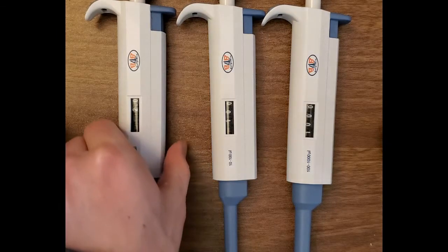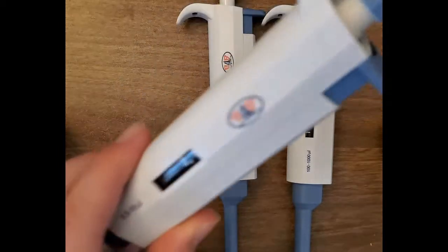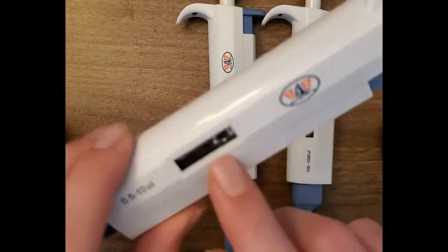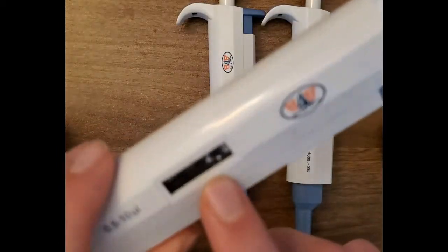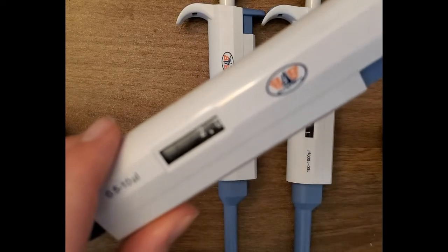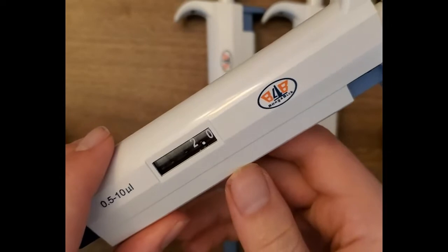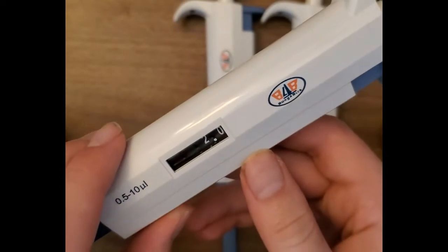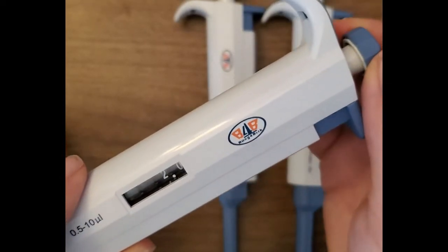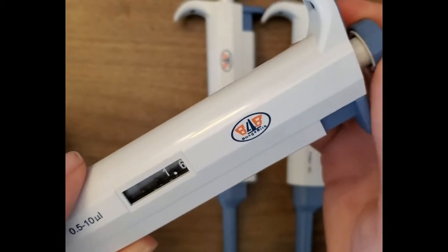At a basic level, you can see here the amount of volume you'll be working with. In this case it would be two microliters. You can change the dial on here and that will change the volume.